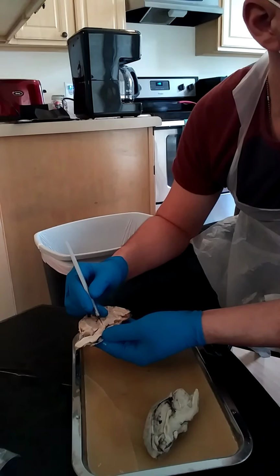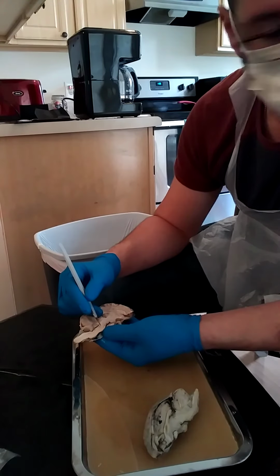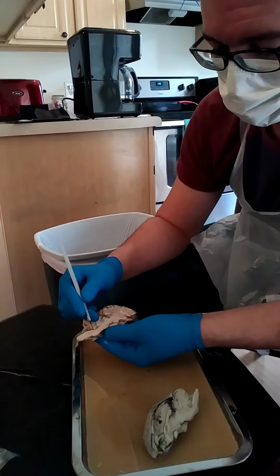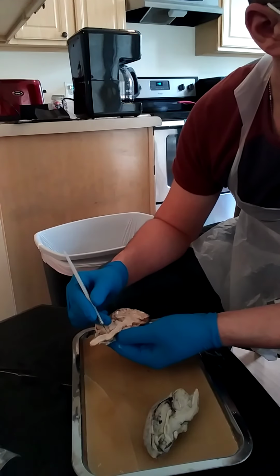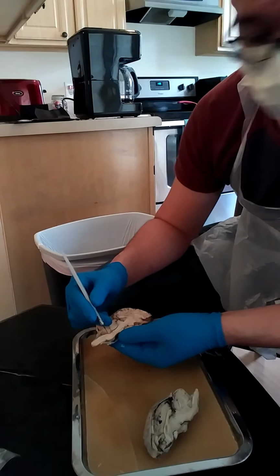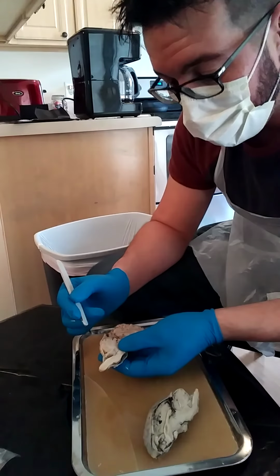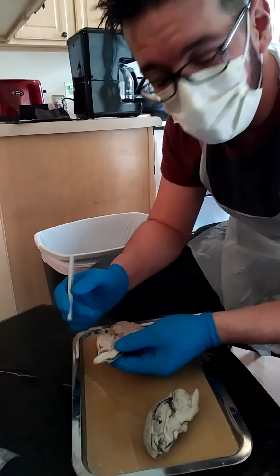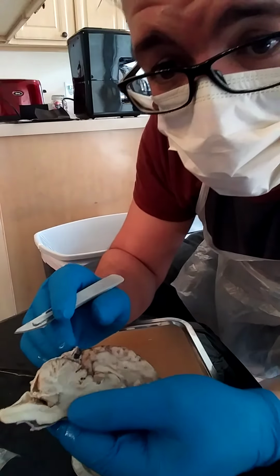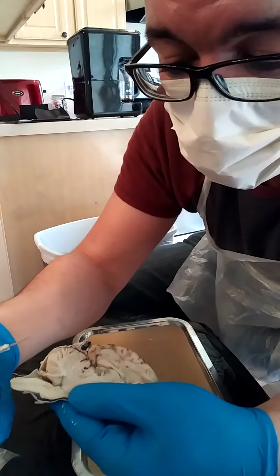After that we have the pons, which extends a little further down. And then after that it transitions to the medulla oblongata, which is inferior to the pons. After that, we go to the arbor vitae, which I always thought was kind of fun. That means the tree of life. Arbor is tree and vitae is life. That's actually part of the cerebellum. If you can see this, it looks like a tree. It's in the cerebellum.